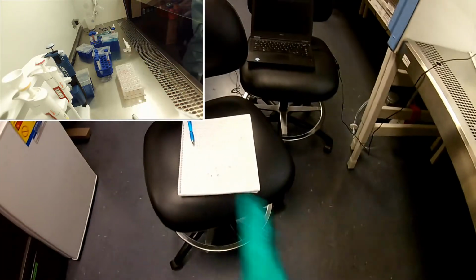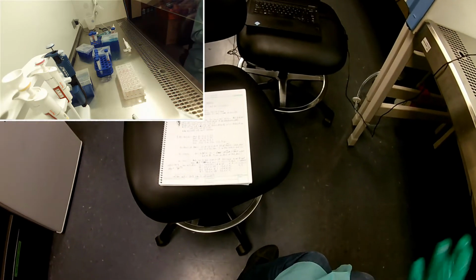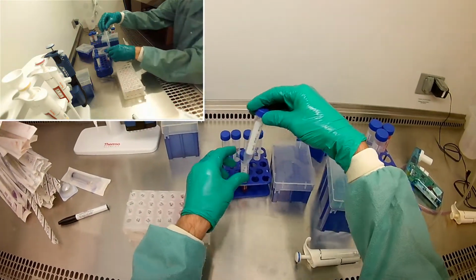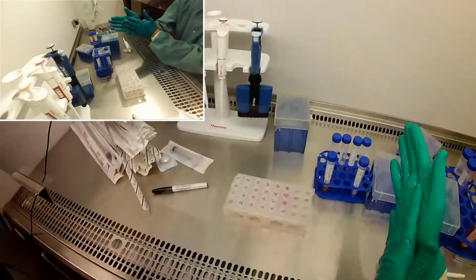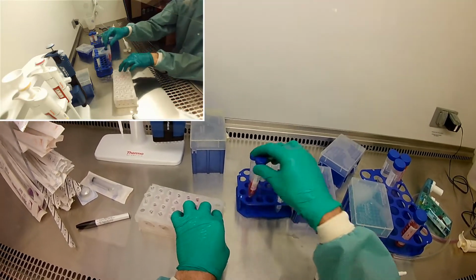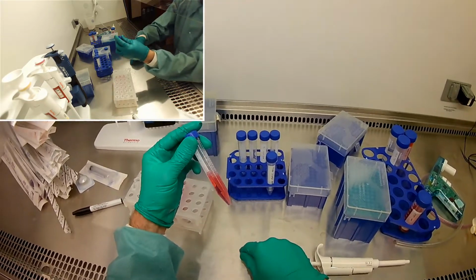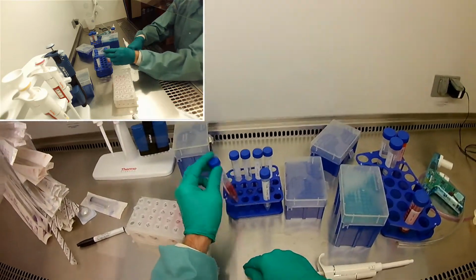I've already got my math done over here, what I need to do. Okay, so to make 22.5, oh, that's right. So yeah, good thing I reminded myself. Right, so number 1, this glucose that I measured out in powder form, it was not sterile. Okay, and so this is not actually sterile inside there. So we need to make it sterile. And there's several ways we could do it.